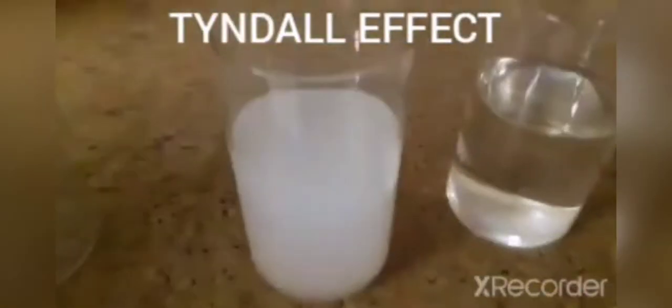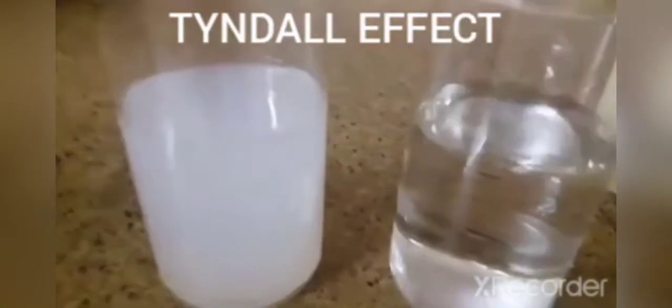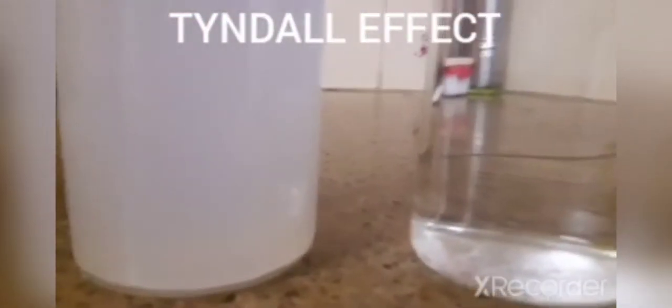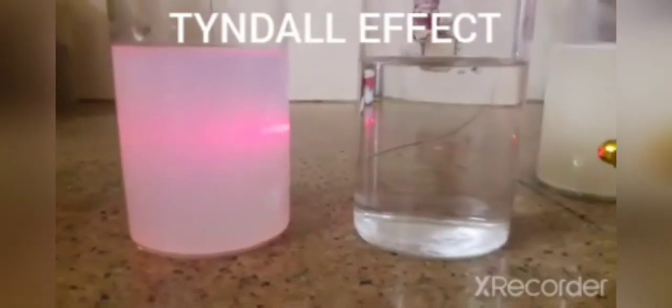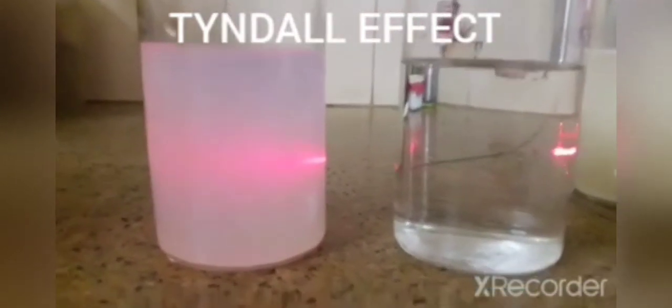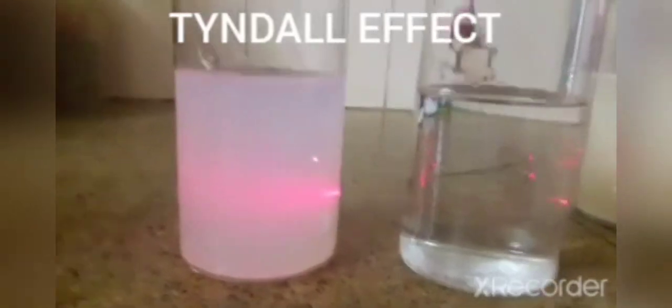And we can check how a true solution does not scatter any light, whereas a colloidal solution does. So here I'll pass light. And you can see that you cannot see the light in the true solution, and in colloids it is clearly visible. Thank you.